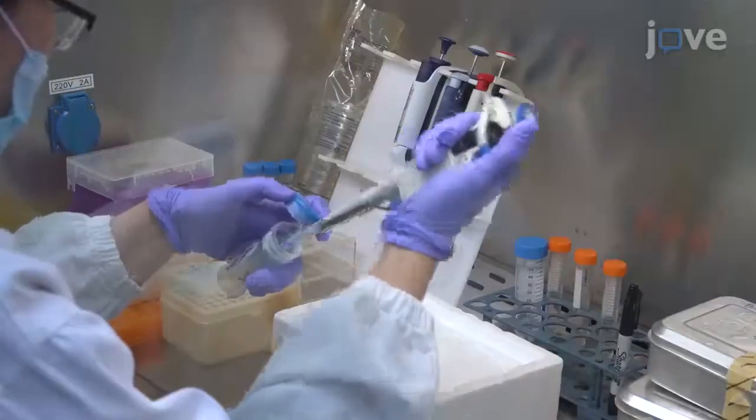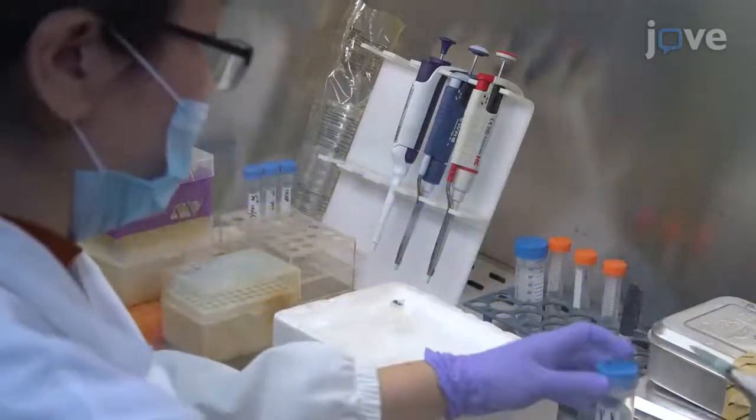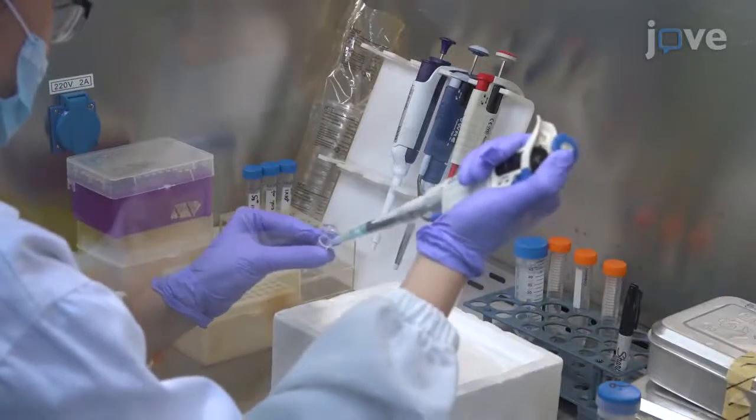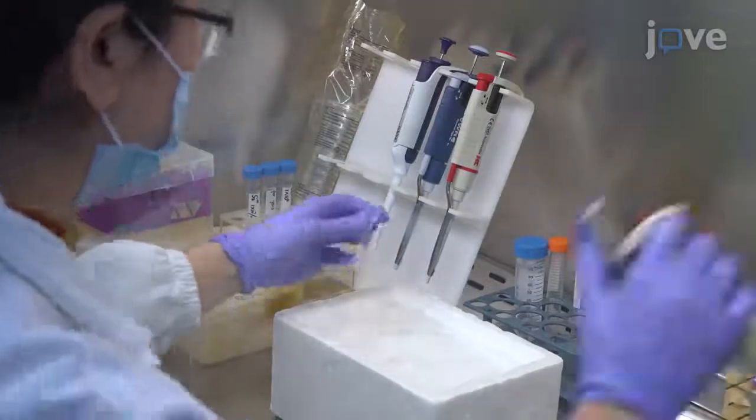During the incubation, resuspend freshly thawed Drosophila C virus, or DCV, to a multiplicity of infection of 0.01 in 1 mL of complete medium and add virus solution to the cell culture dishes.